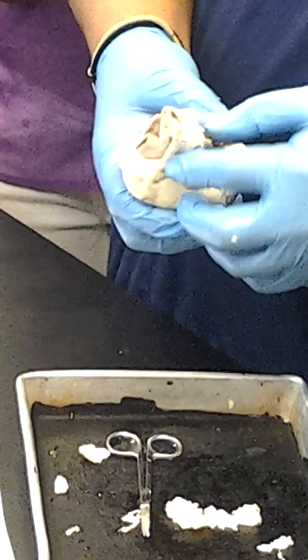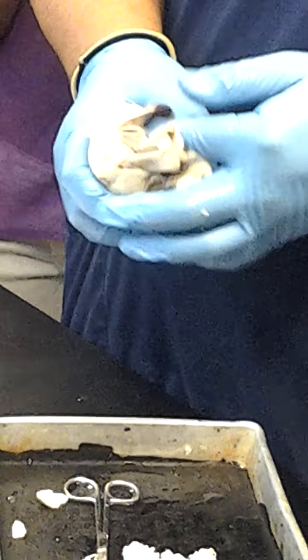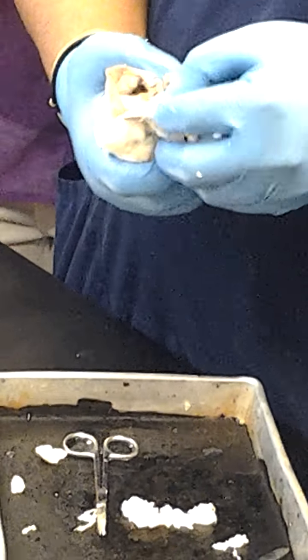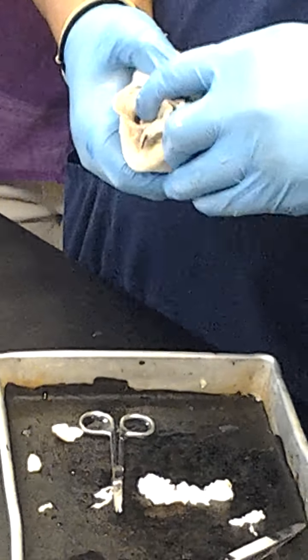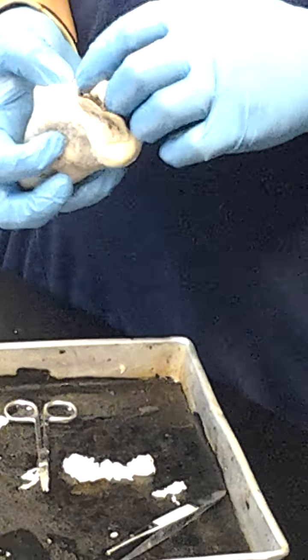So the best way to find the blood vessels is to find what leads into the auricles. So here we have the right auricle. So this, which would have been leading into the right auricle, should have been the superior vena cava right here. So the superior vena cava should have been coming here. And then, of course, there's a hole right here, which would have been the inferior vena cava right there. So that would have been the inferior vena cava.